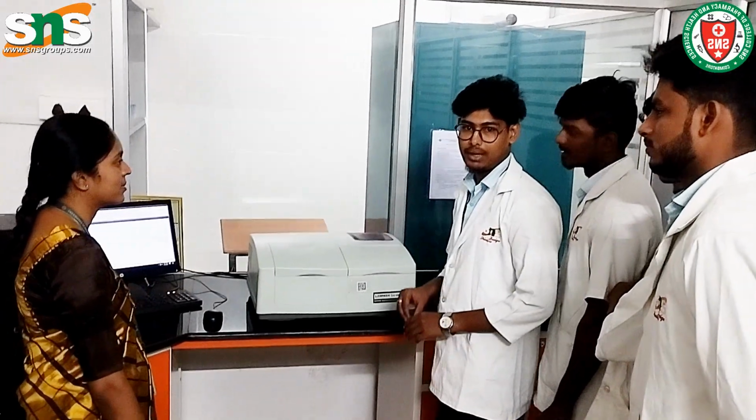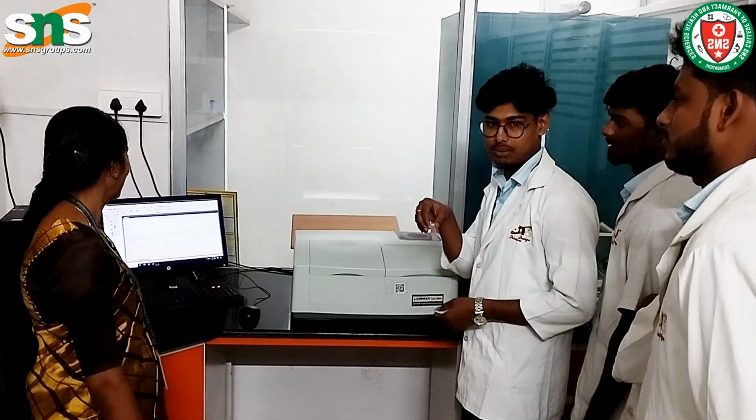Baseline correction done for blank. Now keep the drug sample.